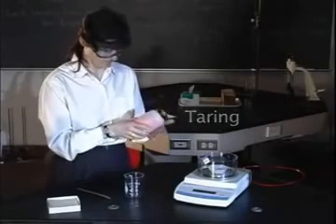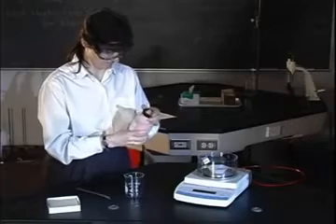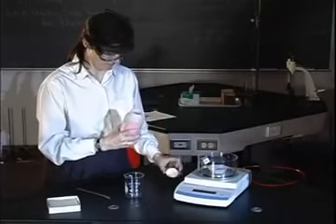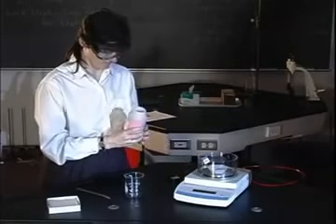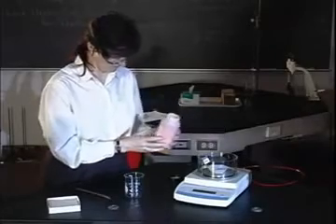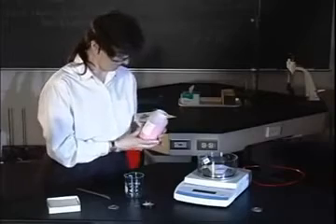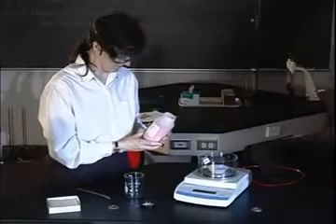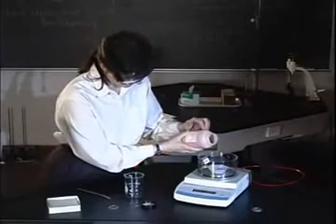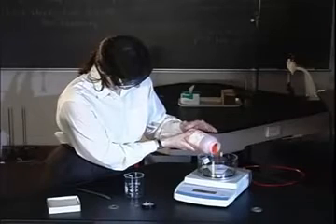Gently tap the chemical container on the side of your hand to loosen the material. Open the container and set the lid top side down on the counter — this will avoid contamination of the lab bench and contamination of the chemical when the lid is replaced. Lightly tap the jar with your hand to transfer the solid material into the weighing tray. Do not place spatulas into the stock bottle of a chemical, as this may cause contamination.